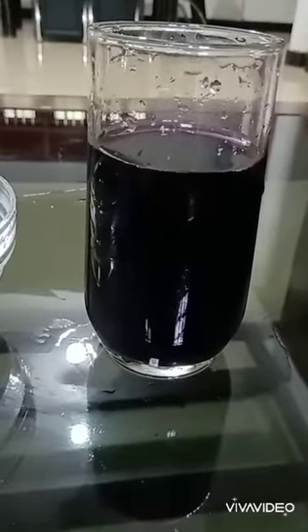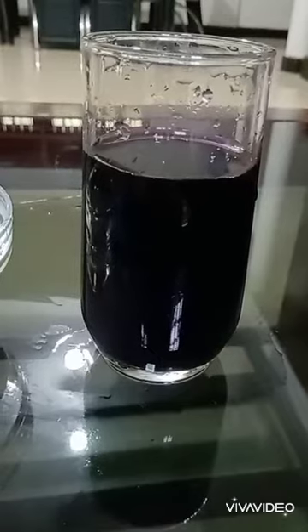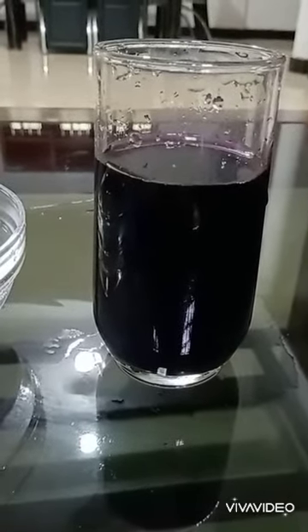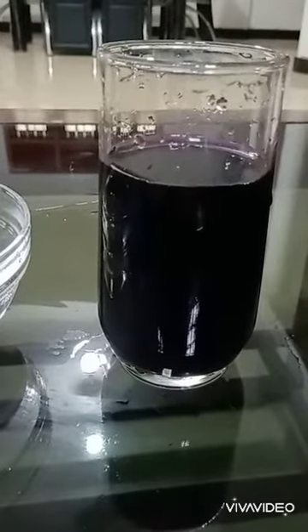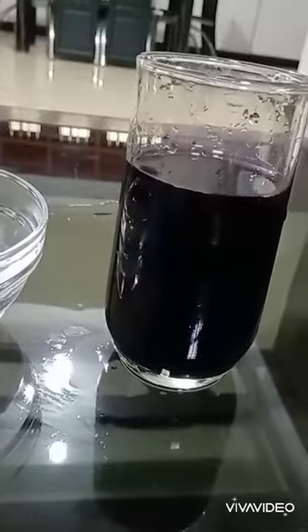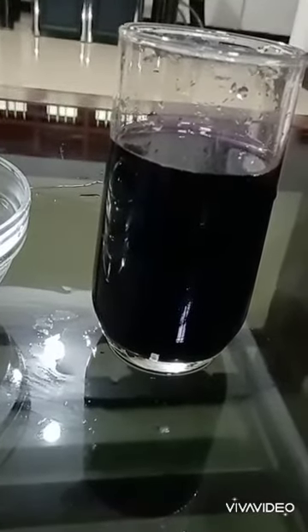When we shake the glass of water gently, the potassium permanganate crystal spreads through the water. The conclusion for this experiment is that there are spaces among the water particles that allow the potassium permanganate crystal to go through.